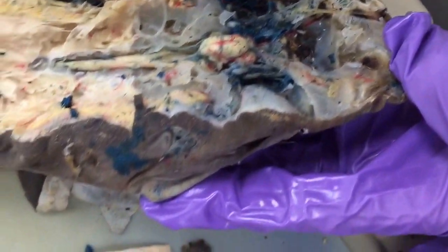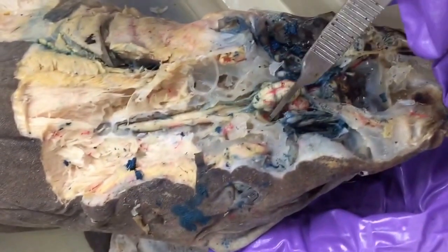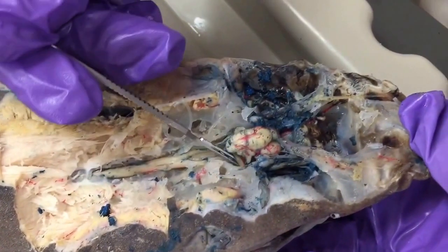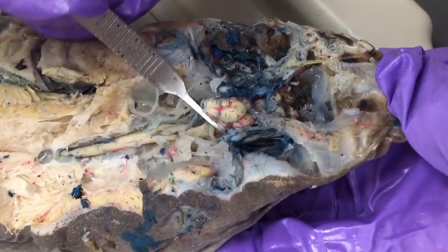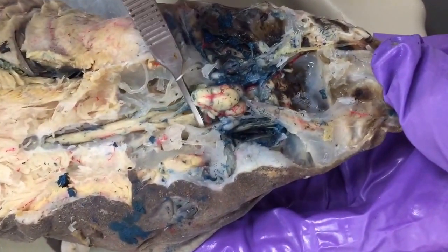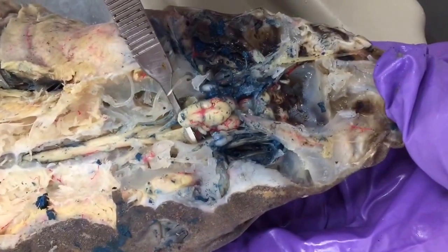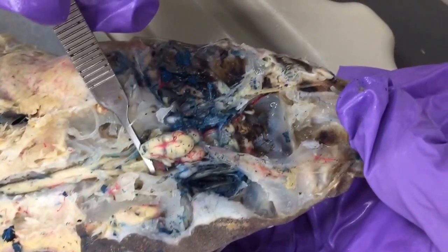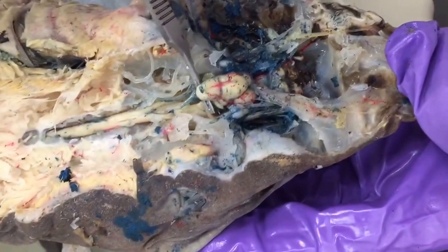Okay, some other important nerves, so we go back to this cerebellum area here and the two ear-shaped auricles on either side. If you pull one of those auricles a little bit over to the side, you can see that there's a large nerve right here that's going laterally. That's the common trunk of the trigeminal, so that's going to split into 3 different cranial nerves, but you just need to know that it's the common trunk of the trigeminal.